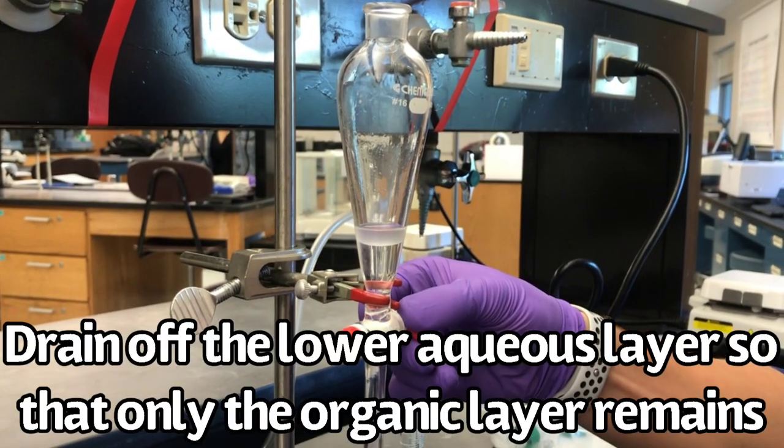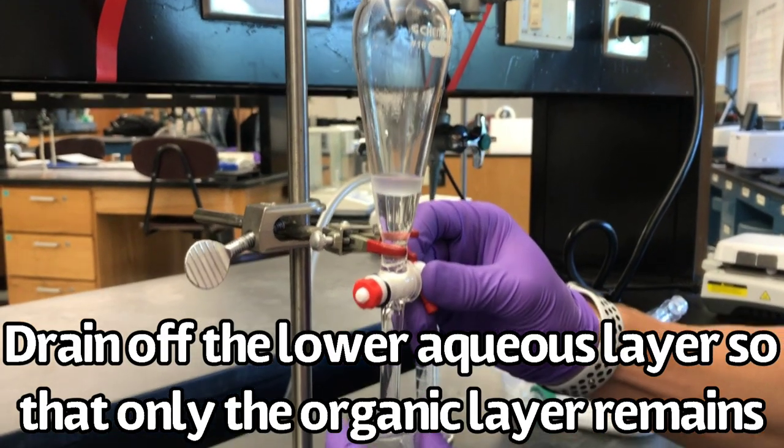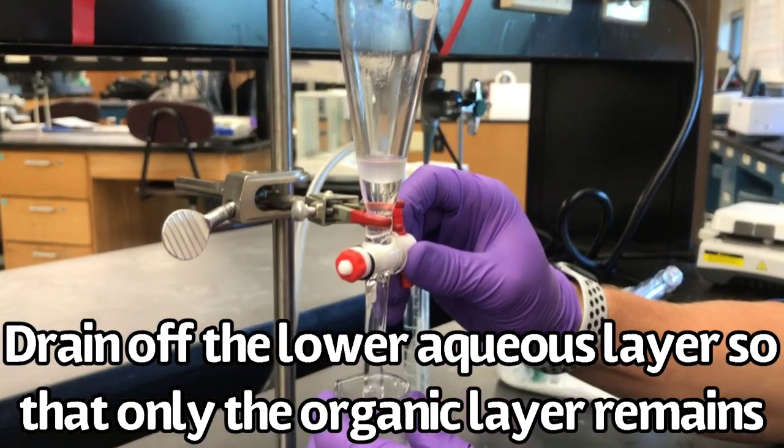Drain off the lower aqueous layer so that only the upper organic layer remains in the separatory funnel.